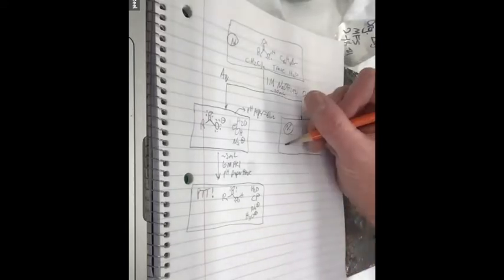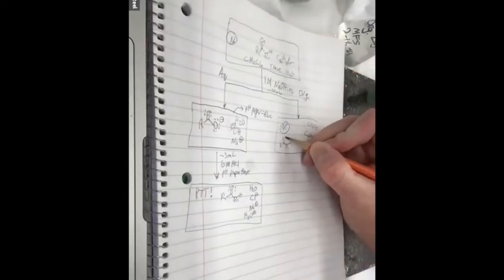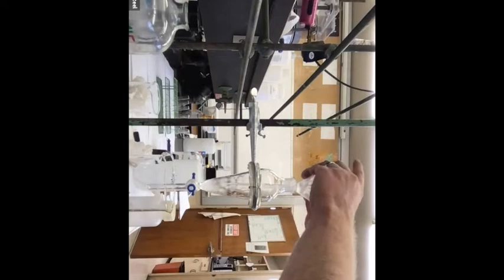And maybe some more acetic acid, huh? Maybe it didn't all come out in that first extraction. There might be some of that still in there. So should we check for that now? Sure. How should we do it? Following the same process as the last step, right? Yeah. So this is my second organic layer. Add it back. Oh, is the stopcock closed? It is closed. Add that back in.